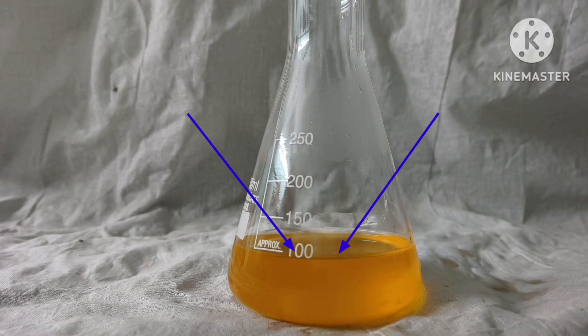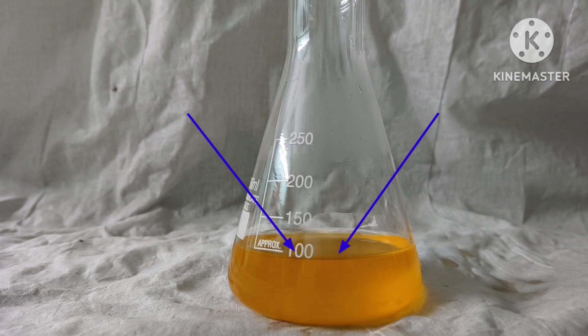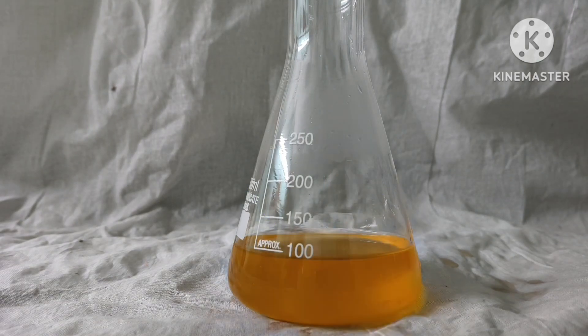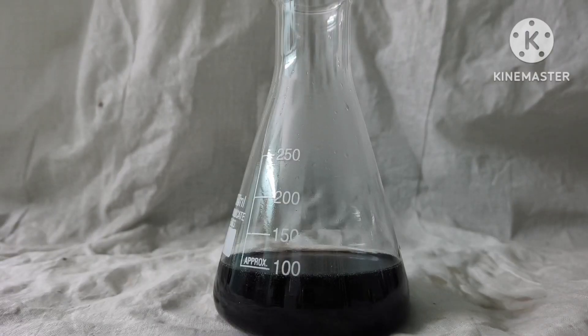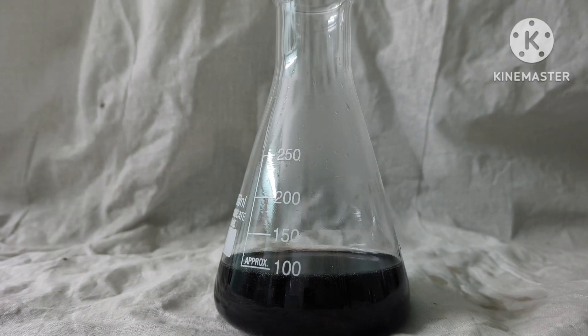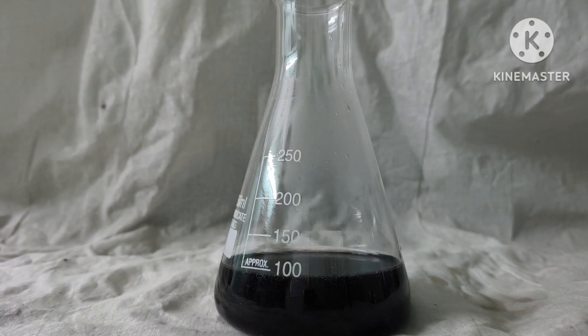Just concentrate, concentrate... oh my god! Wow, you can see that the color changed in a millisecond and this is one of the best experiments of my life.